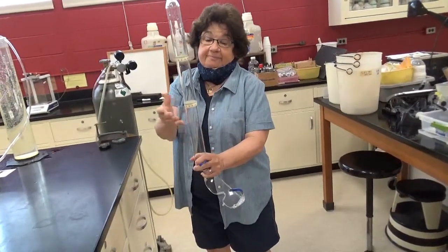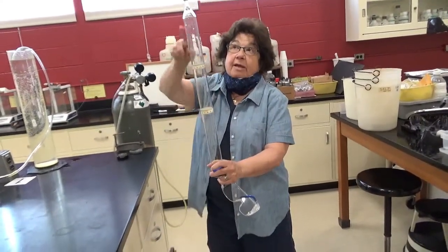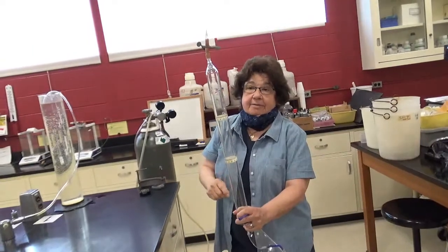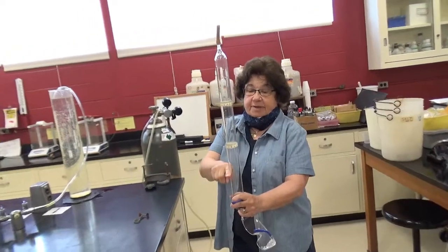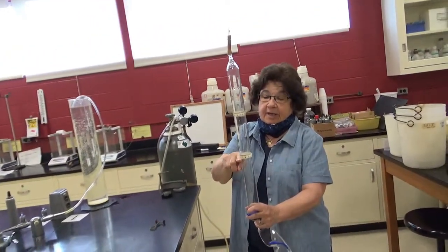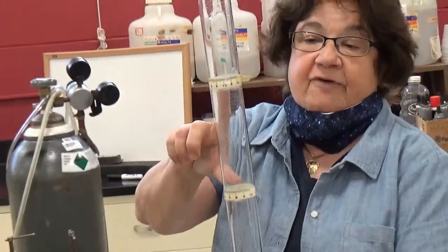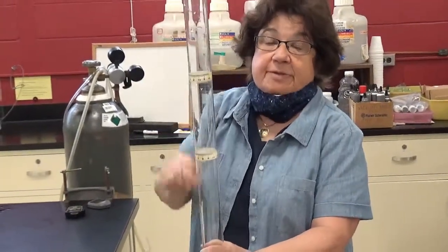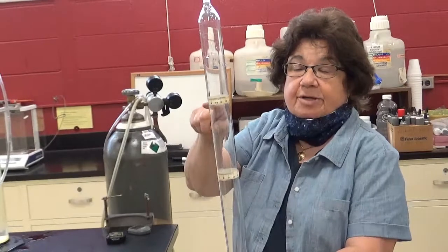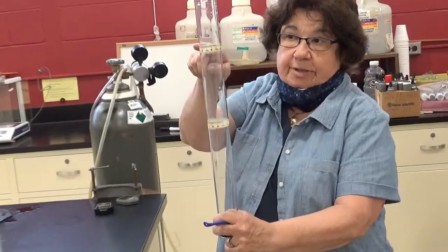Now, if I open up the tube, the gas will then be leaving very slowly by that little tube. So when I take this off, the water will be filling this up very slowly, depending on what gas we have. And we have these 2 little tape measures to measure a volume of the gas leaving. Because if we want to compare different gases, we have to keep the volume of gas that leaves the tube the same. And so we're going to be timing how long it takes the water to go from one point on this tape to another point on this tape.